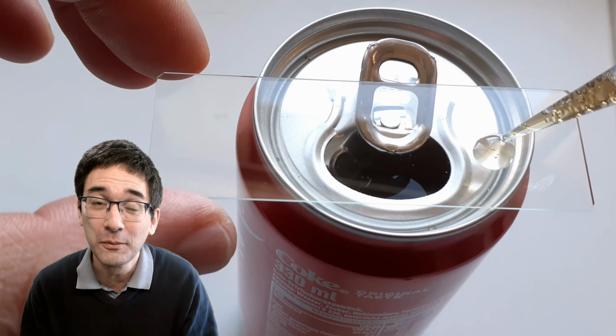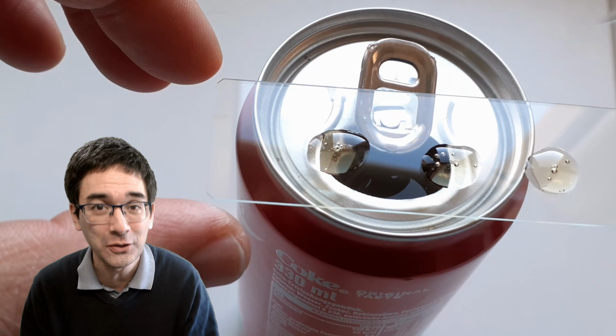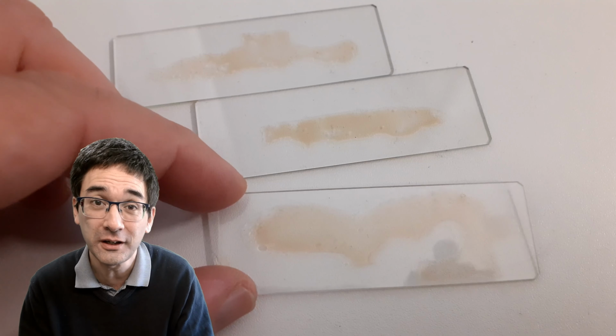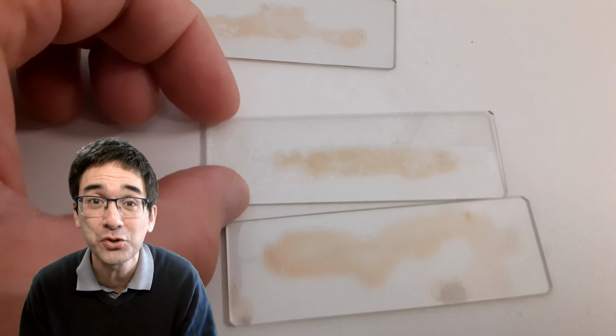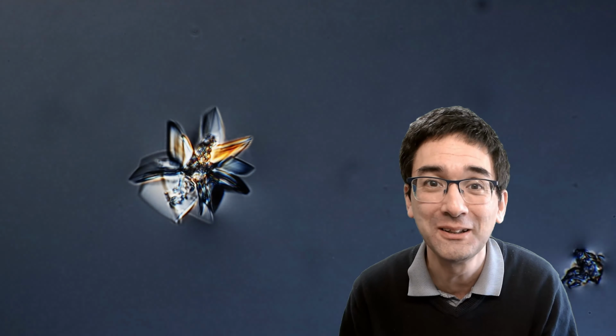Well, of course, if you put Coke directly under the microscope, you are not going to see a lot. Why not? Because Coke, being a liquid, being a solution, is very homogeneous. So what I did is I put it on a microscope slide and waited, I would say a few hours and maybe a day, until all of the liquid evaporated. And this is what I saw, a very small crystal.